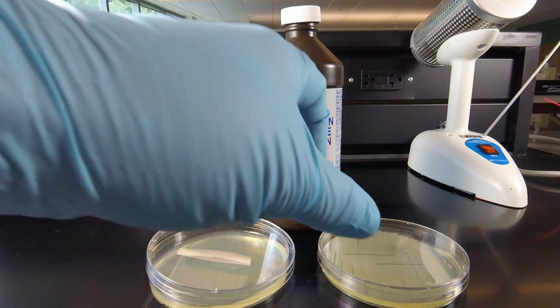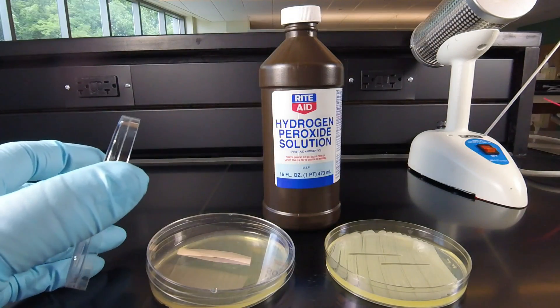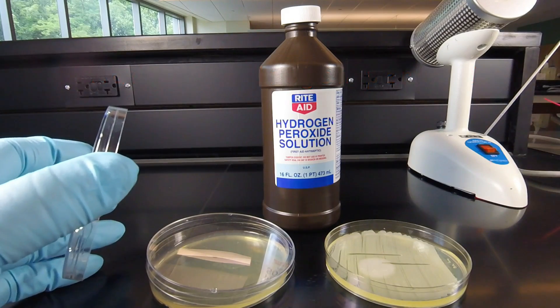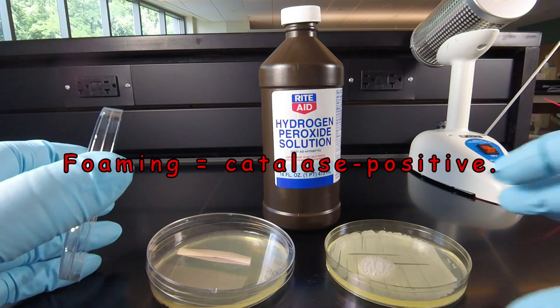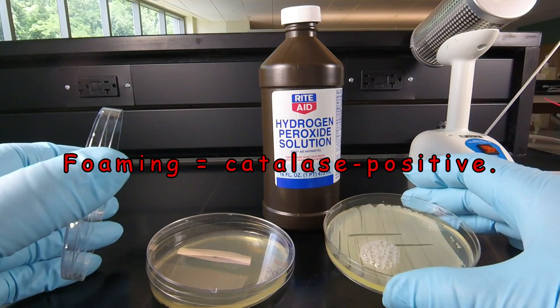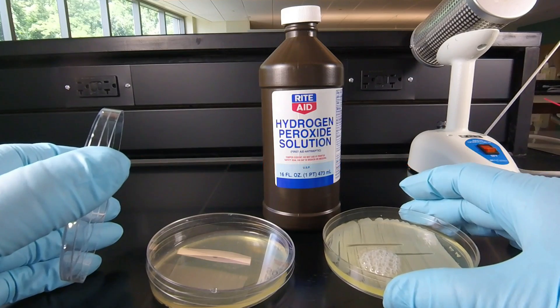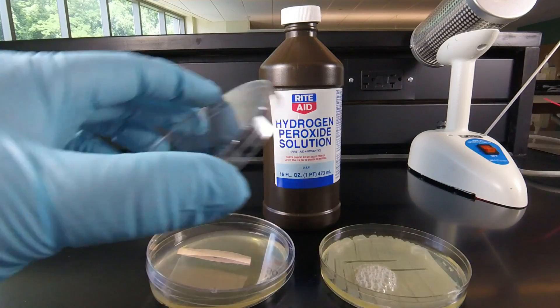On the right we have a plate of Staphylococcus aureus. That is a catalase positive bacterium, and if we add the hydrogen peroxide to the Staphylococcus we see immediate foaming, indicating this organism is catalase positive. The hydrogen peroxide is being broken down by the enzyme catalase into water and oxygen, and the oxygen bubbles through the water.